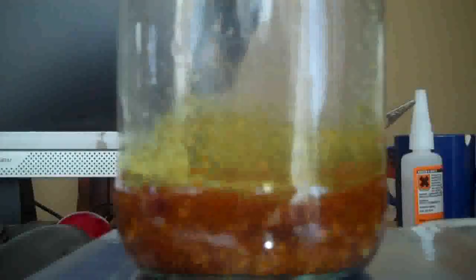In that jar we have 50 millilitres of acetone. To it we need to add one gram of iron(III) chloride — it's not particularly critical how much you add, but the guidance is one gram. You can add more if you like. Just scrape that in; it's going to fizz up a little. Add the iron chloride and give it a stir, then add half a gram of your carbon nitride. It looks like quite a lot because it weighs practically nothing. Stick your half gram of carbon nitride in and give it a little stir.